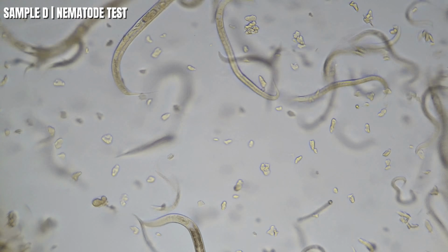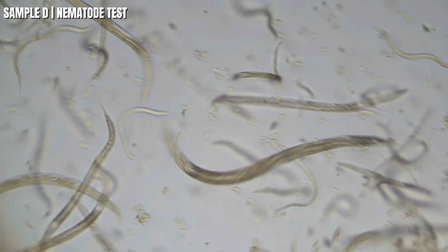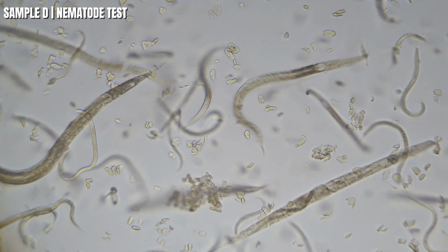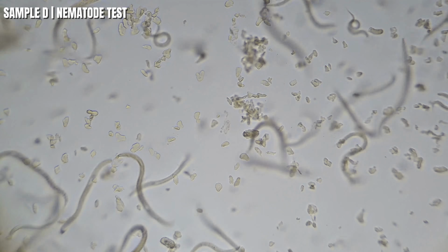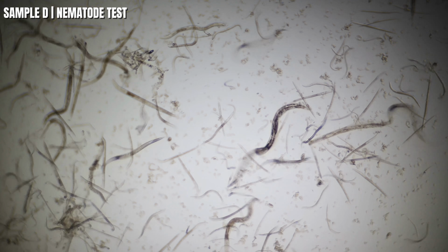That's a little better. So see the adults right there? A lot of adults. There's some babies in there too as well. So it looks like they're slowing up. It only takes time before this hits them hard. So let me zoom out and get a clear picture of what's going on here at the scene. Yeah, look at it. They're slowing down, of course, and there's still one of the super strong ones there. They're still going, but I watched the slide for a good 20 minutes, and eventually they all come to a halt.